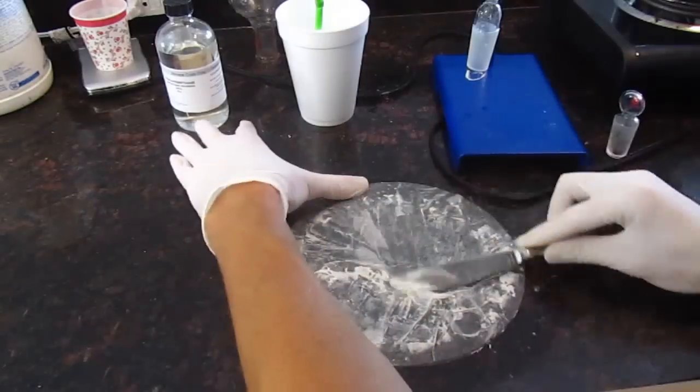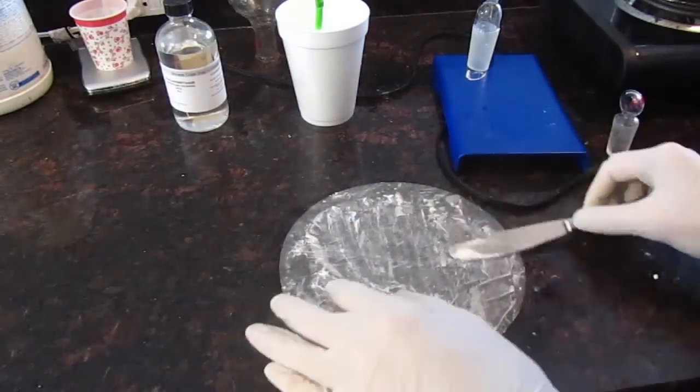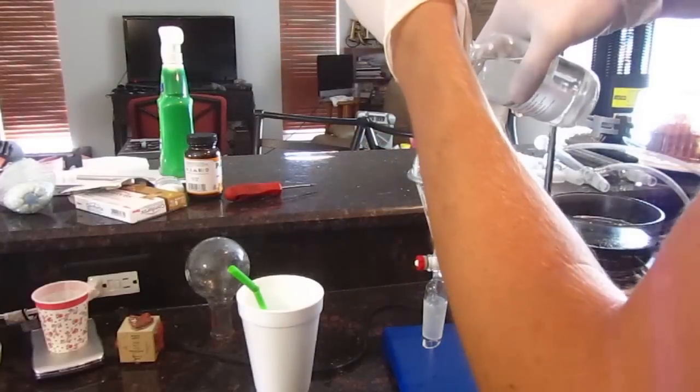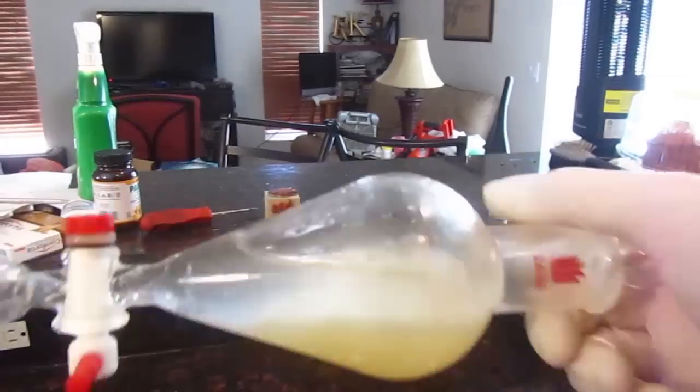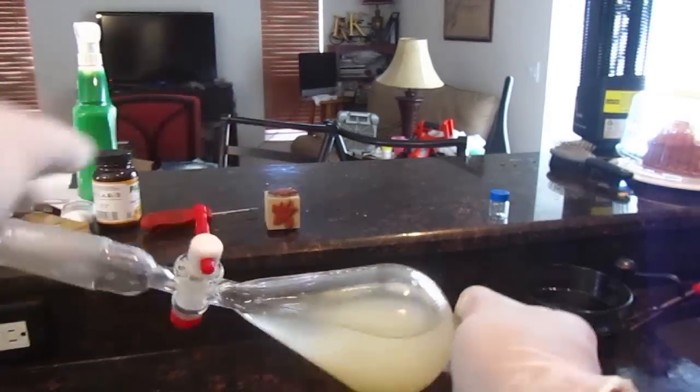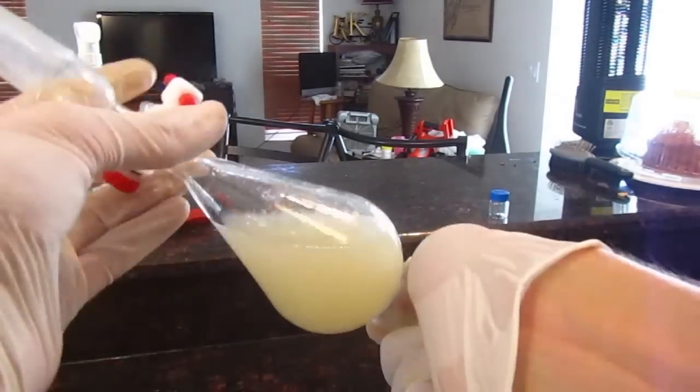So here I am, loading up the separatory funnel with my product. And I'm going to add some dichloromethane, or methylene chloride, along with some water to get any salts that made it into there.